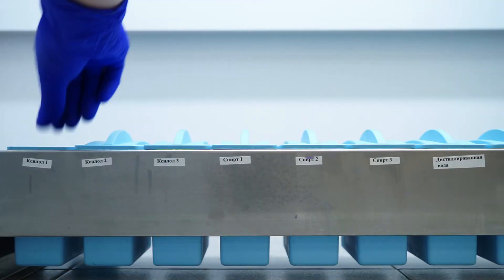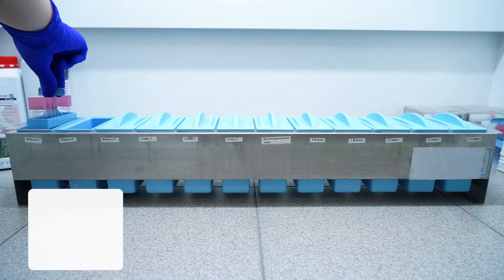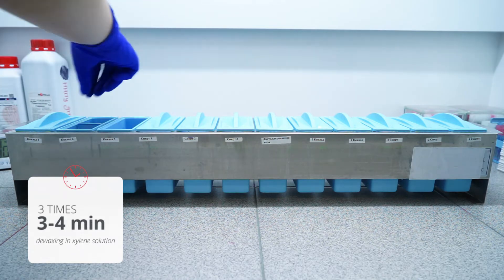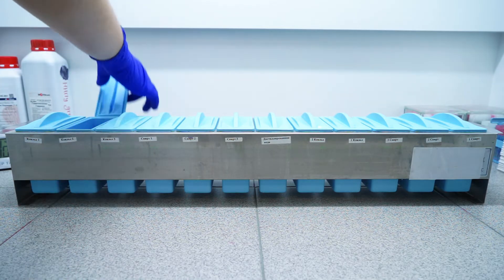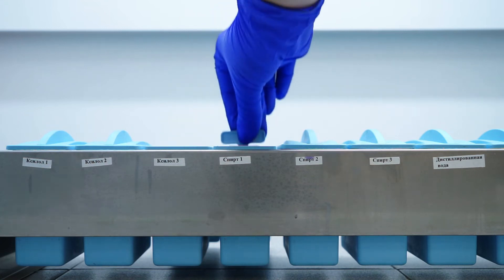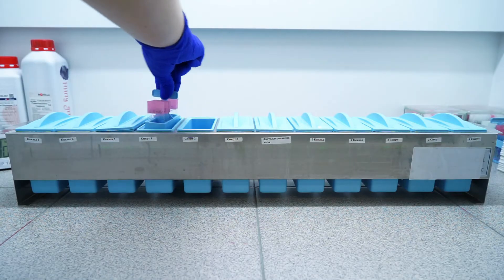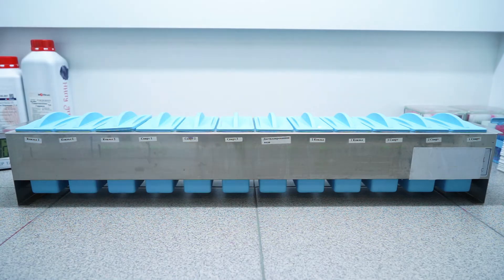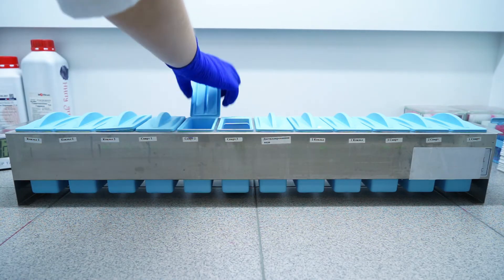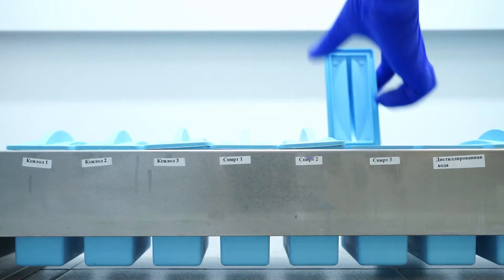The first step is dewaxing in xylene solution three times for 3–4 minutes. Then rehydration in alcohol solution — we use isopropanol, though ethanol can also be used. Then we wash the slides in distilled water.